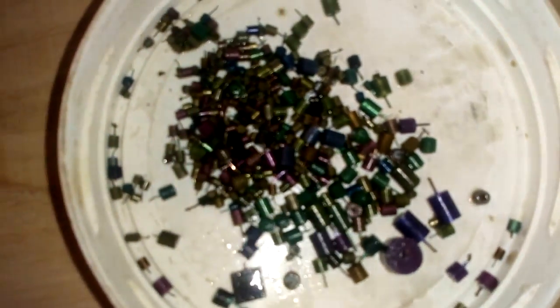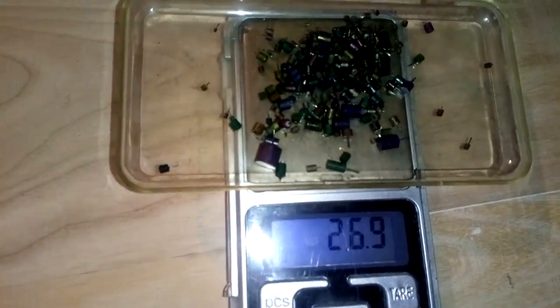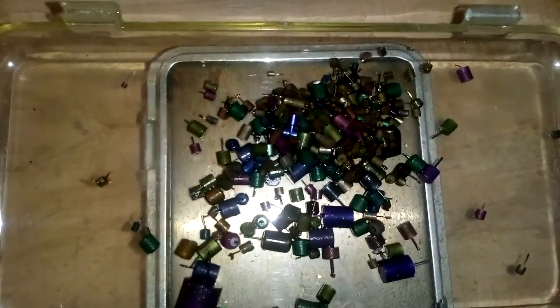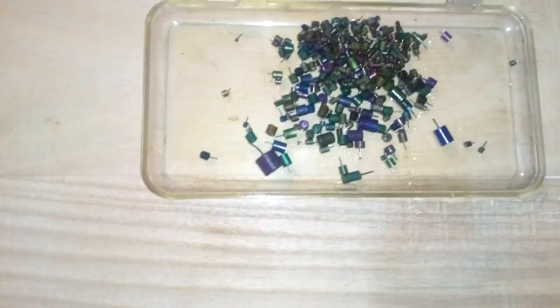After washing, this is our tantalum — it's mostly gray and green. Now we'll check it on the scale. We got 26.9 grams — so almost 27 grams of clean tantalum. Now we need to find some buyer for this.